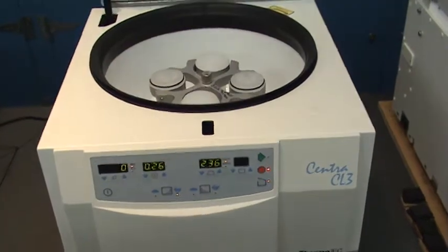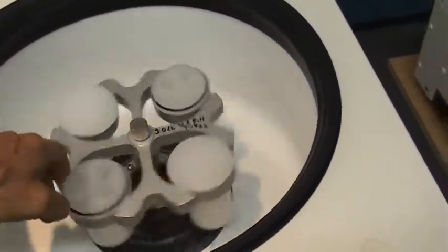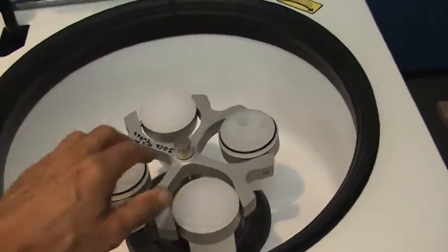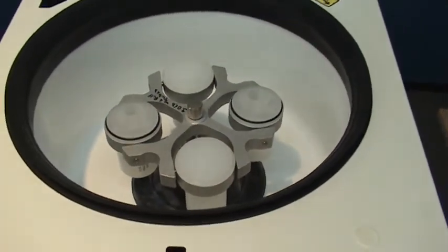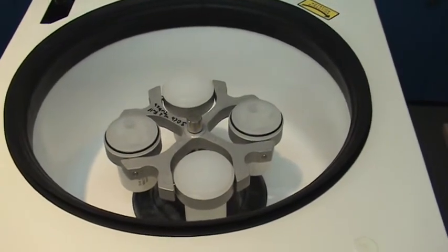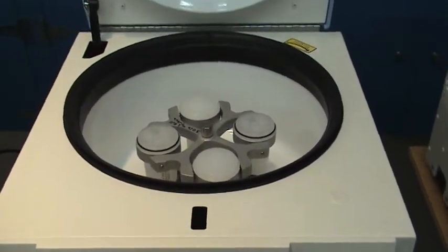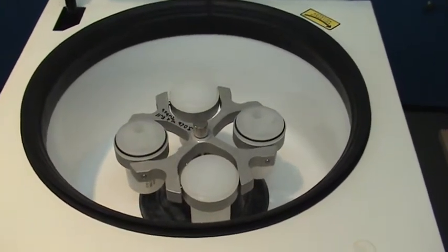If we open the lid of the centrifuge, this particular model has a standard rotor. This rotor, when fully loaded, weighs about 3 pounds. And you'll see that this centrifuge has a mechanism built into it that allows the rotor to adjust to some extent to the imbalance of the centrifuge load. This particular centrifuge is capable of tolerating about 10 grams of out of balance mass.